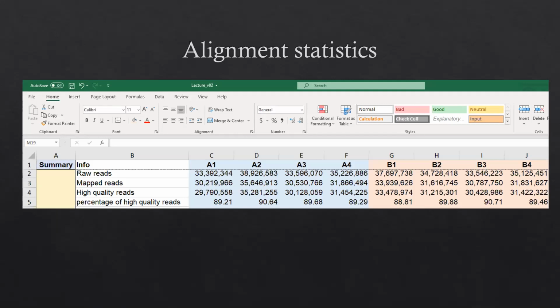Here is the alignment statistics file we generated after STAR mapping. You can see the first row shows the raw reads for each sample. Here we have 8 samples in 2 conditions. The second row shows the mapped reads: when we map the raw reads to the reference genome, how many reads can be mapped under the cutoff. Here it shows the high quality reads after we remove some low quality reads, and that's the percentage.